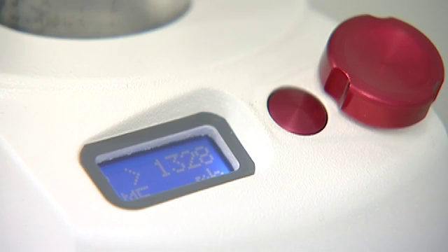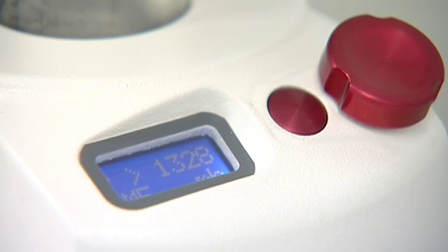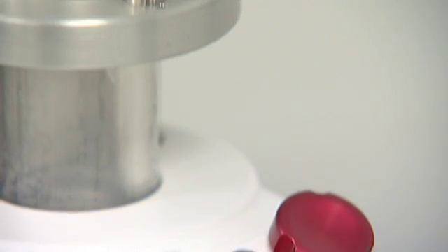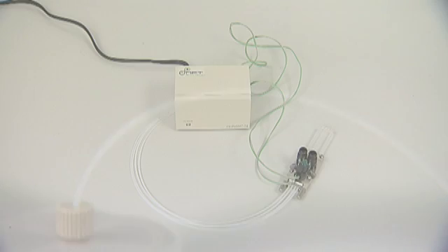To achieve the highest possible consistency in flow rate, the Mitos P-Pump uses gas pressure for ultra-smooth flow in a convenient low-cost package.